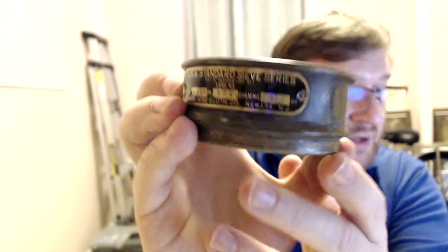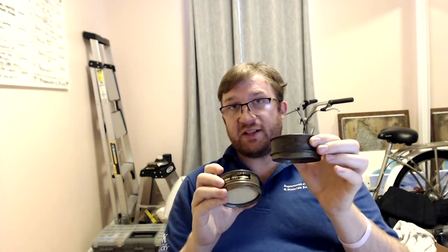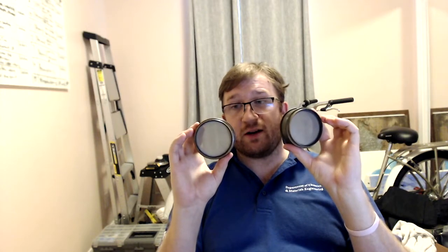It's a little fuzzy. But this is 70 mesh size. This is 325. You can look up the opening sizes and it'll be very similar. So basically, the 70, which I've got right here, is a larger opening. 325 is a smaller opening size in terms of my two grids here.